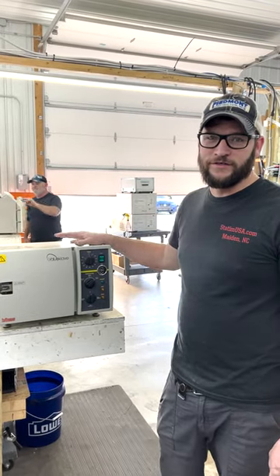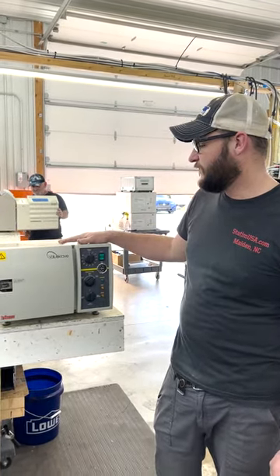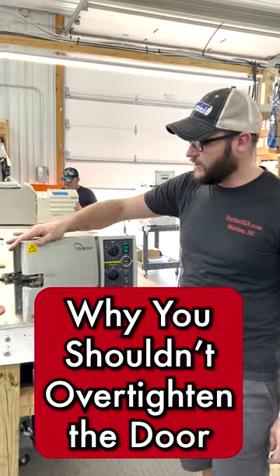Hi, this is Ian with Sterilizer Autoclave Solutions. Today we're looking at the 1730 ValueClave and why we do not tighten down the door too much.